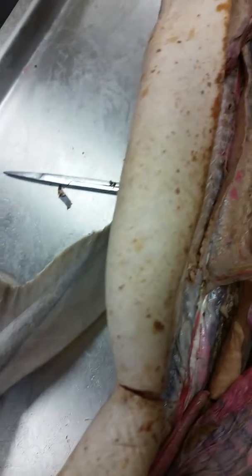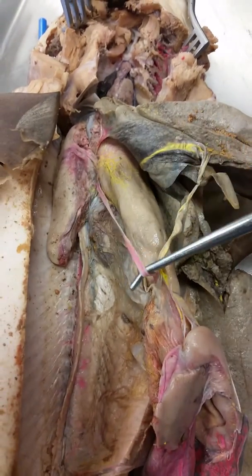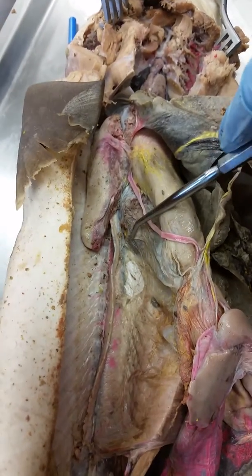We're looking for the celiac vein, which is right here, or the celiac artery — it's right there.